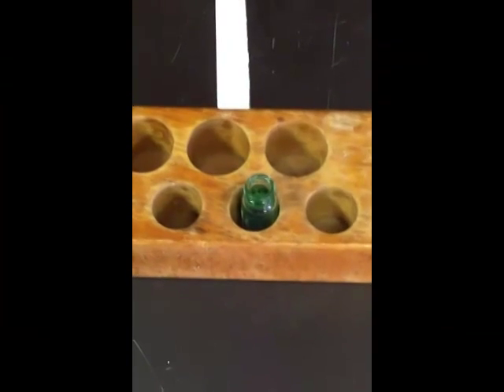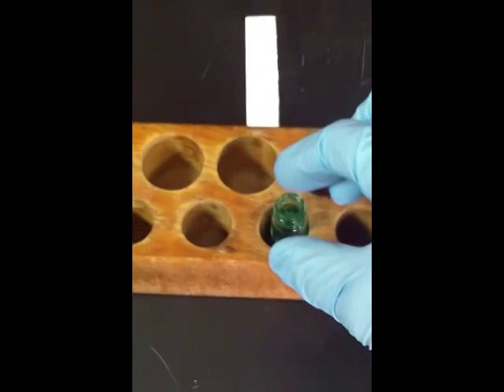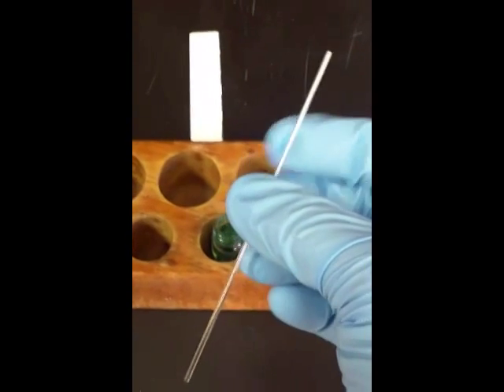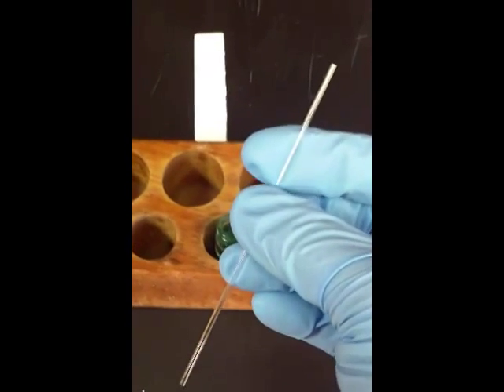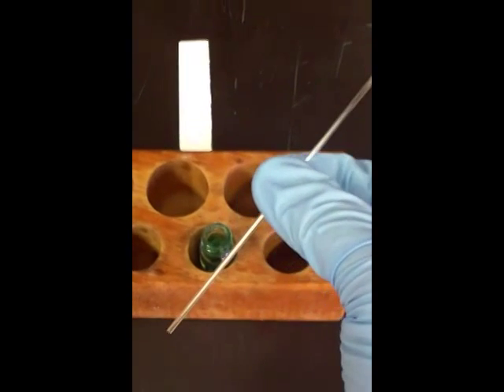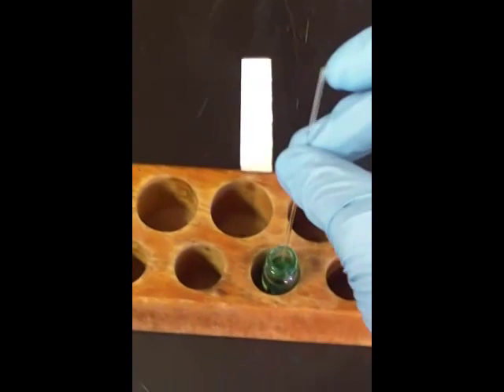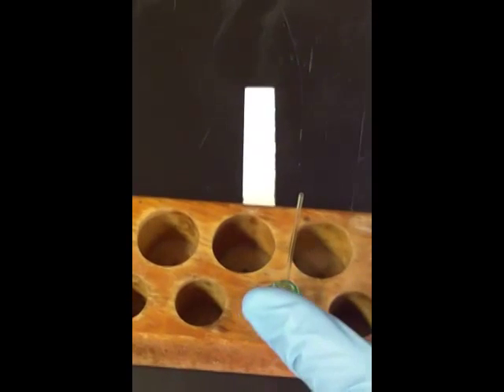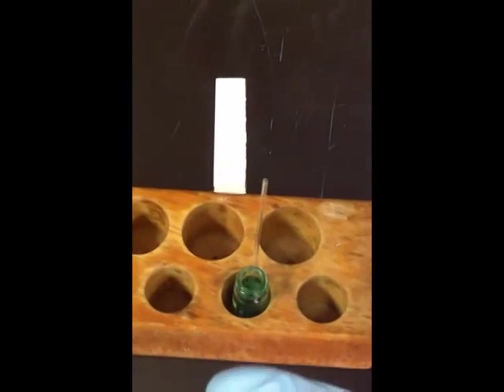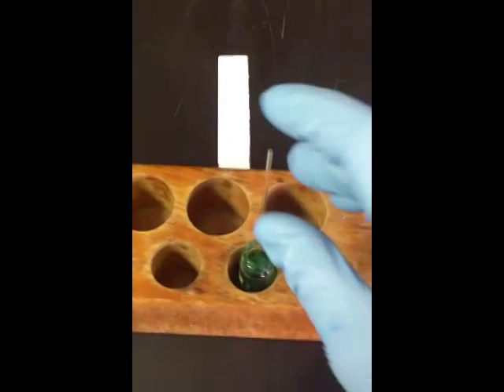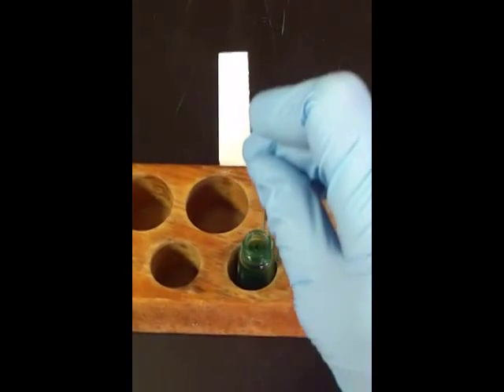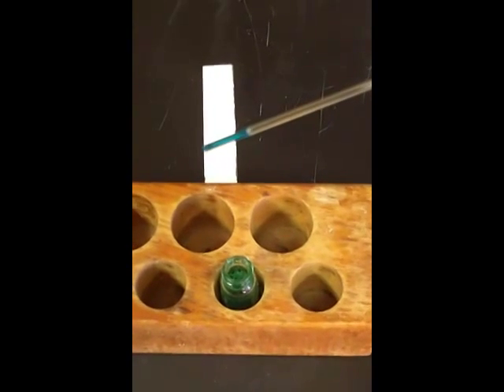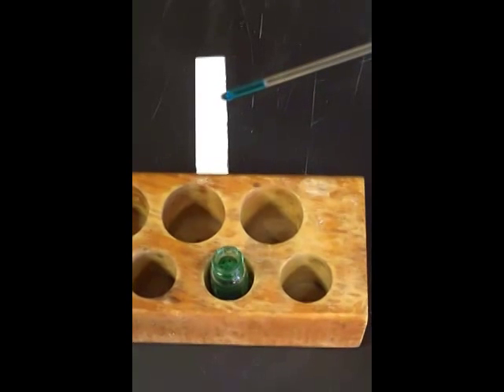Now to use the capillary tube. We'll have a little block here to put our vials in, less likely for it to spill. Our capillary tube is open on both ends with no bulb. To draw up the liquid we're going to put it in the solution. Notice I'm not putting my finger on it. Once it's in the bottom, it's going to be drawn up the tube by capillary action. We put our finger on the one end.